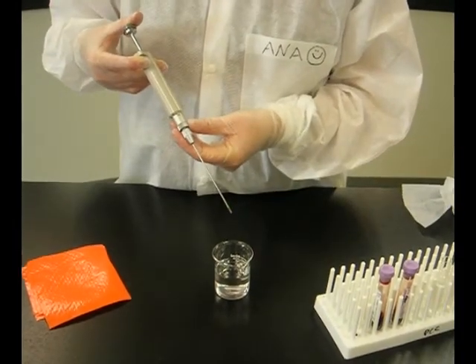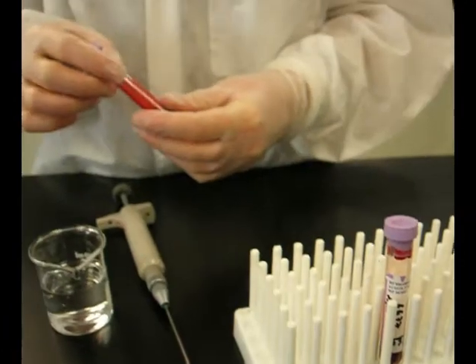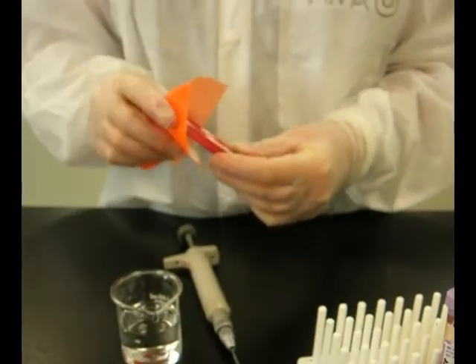We are going to pipette 10 microliters of blood into a saline solution. Make sure to mix the sample very well.